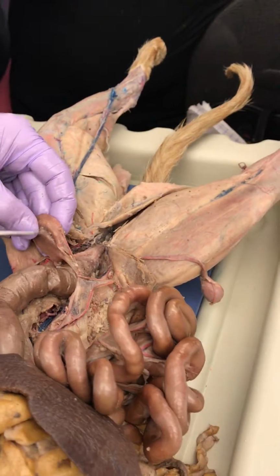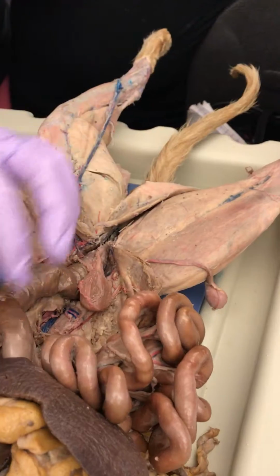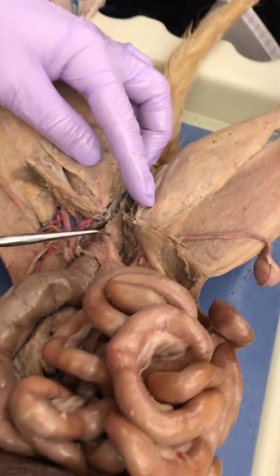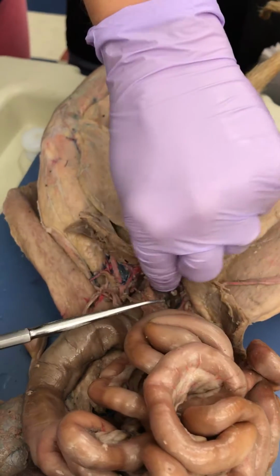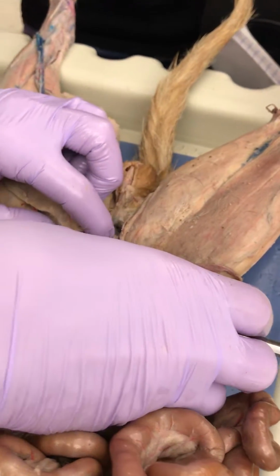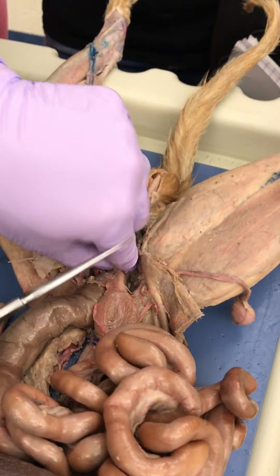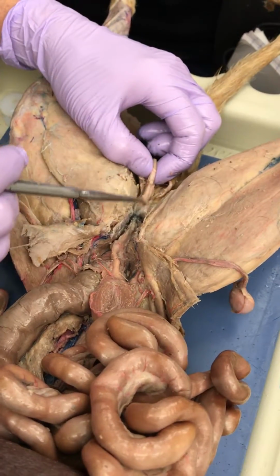What organ is this? Urinary bladder. So we have to call it urinary bladder, because we also have a gall bladder. Okay, so what's this tube right here? Urethra. That's good. And did your guy have a little hard spot? He has a little one. You can feel it. It's not much. They had the better one behind. And then what are we feeling? Prostate gland.